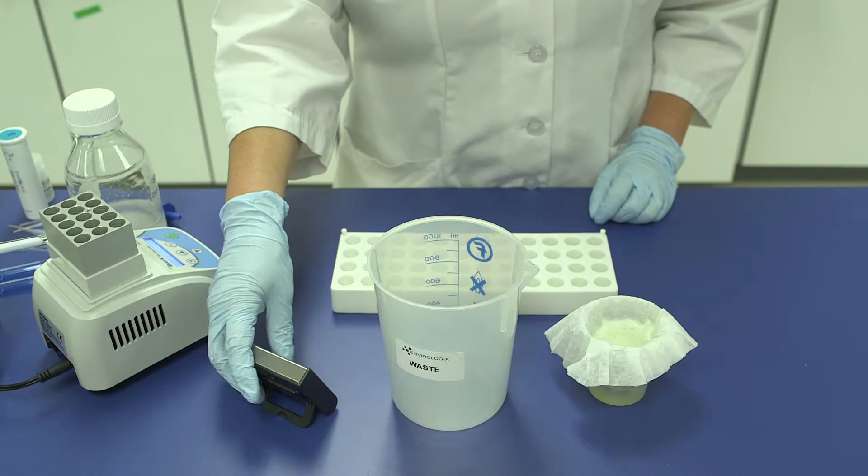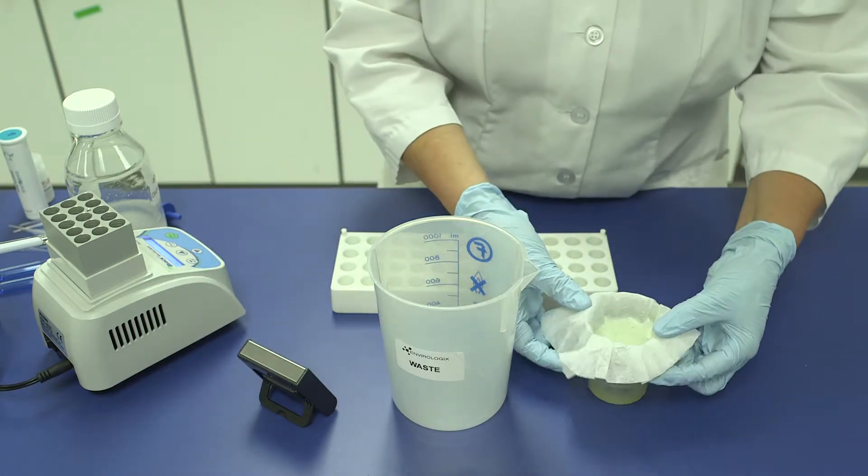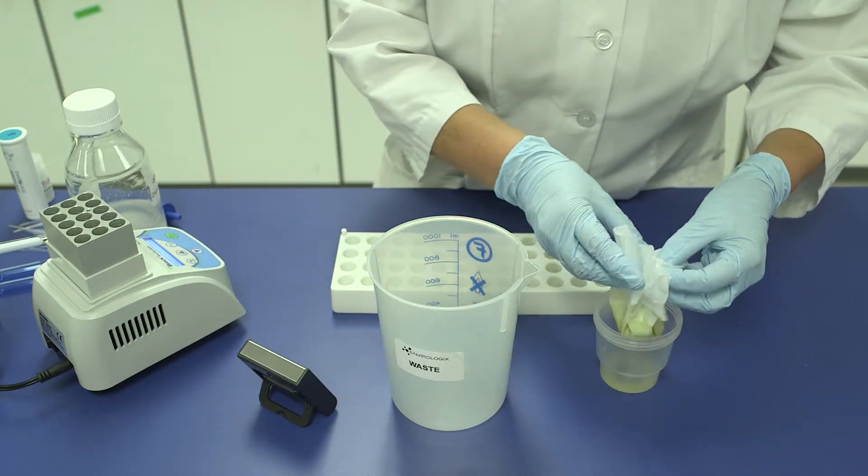See the available accessories section of the product insert for ordering information. Also, if clarifying the sample using the filter method, remove and discard the filter after 2 minutes.